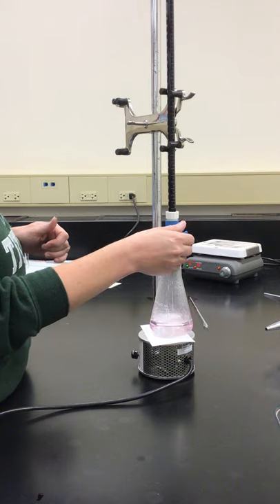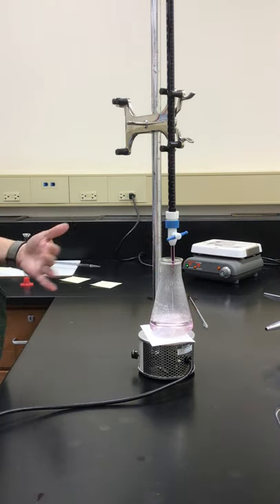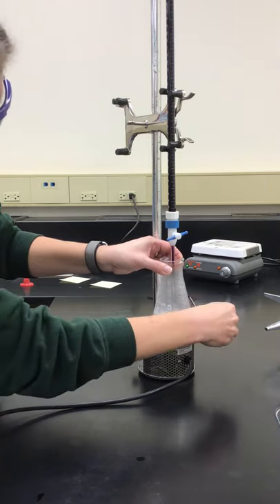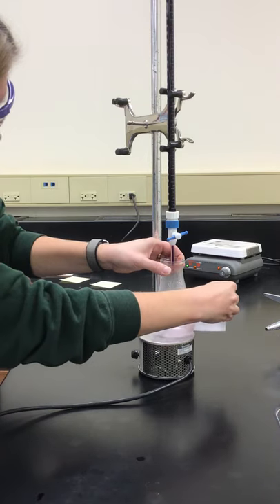It's getting longer. And now we have that faint pink color. It's no longer white, it's got a little bit of a pink tinge to it.